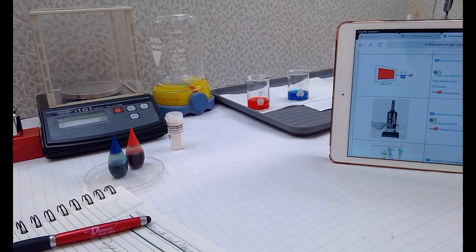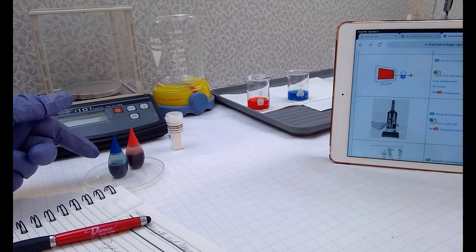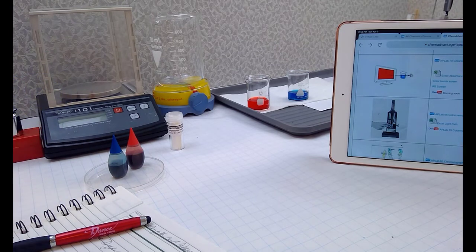We are ready for a lab on absorbance of photons, visible photons that is, and wavelength, and some solutions. And the solutions we'll be dealing with are going to be, at first, just our McCormick red dye and blue dye. And then we're going to deal with my favorite indicator of all, which is phenolphthalein.